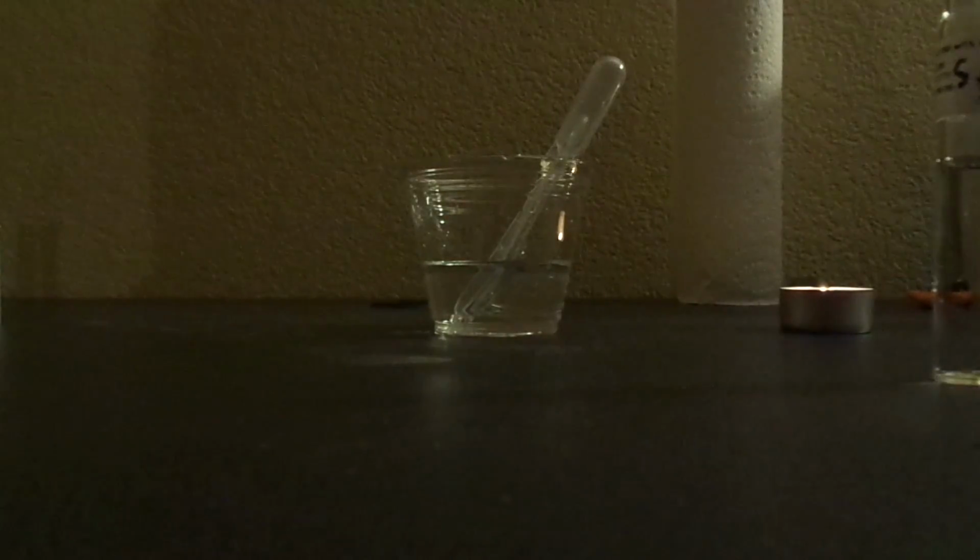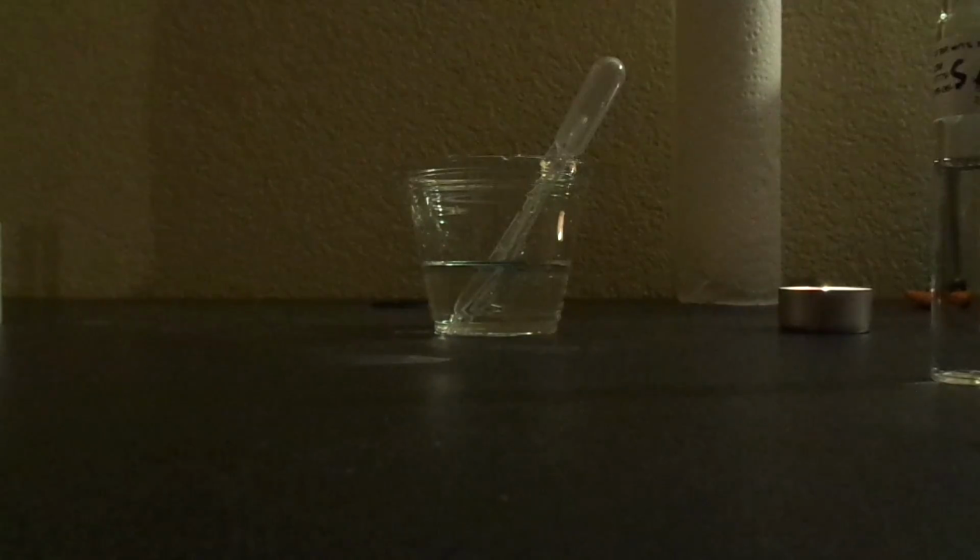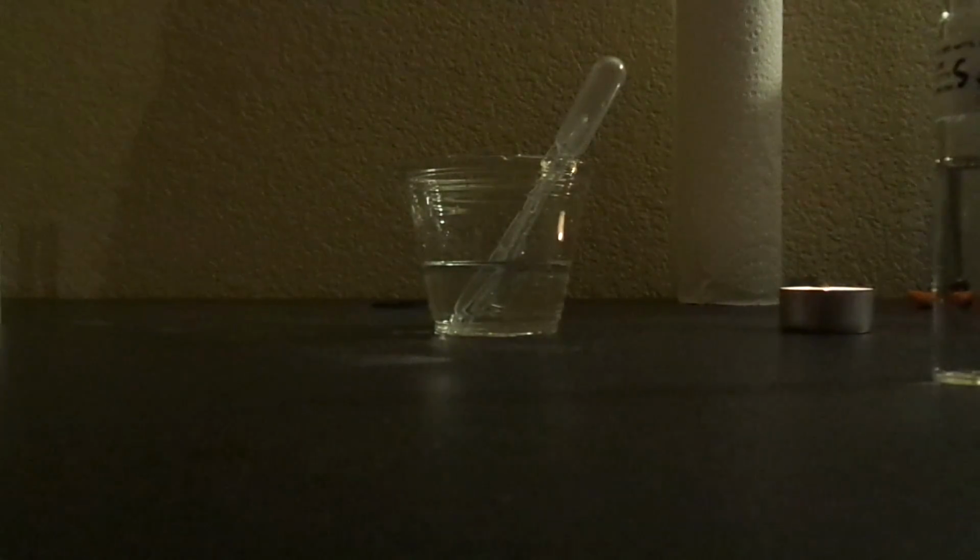And also for these, we're going to incubate them for 24 to 48 hours. We're going to check this for turbidity. Going to see if there's any growth. And if there's any growth in that time frame, then that indicates a positive test result. If there's no turbidity, no growth, then that's a negative test result. It wasn't able to grow in that particular environment.